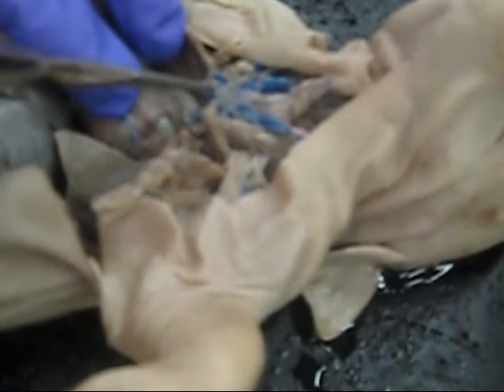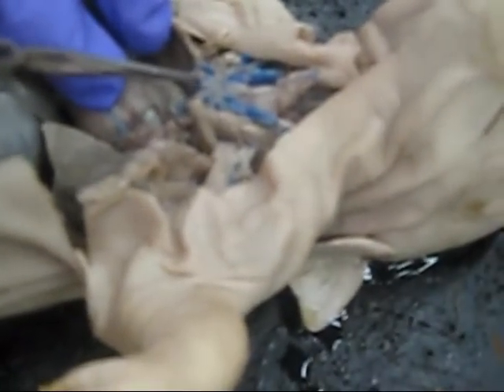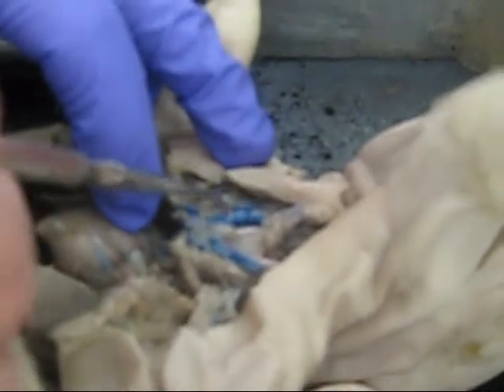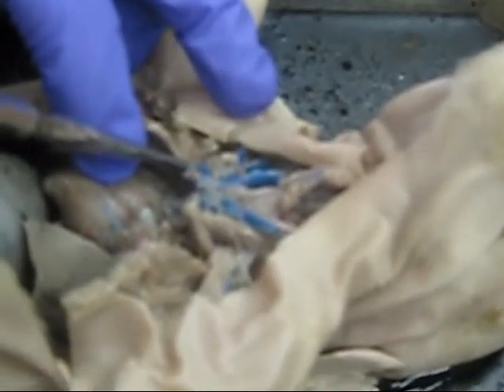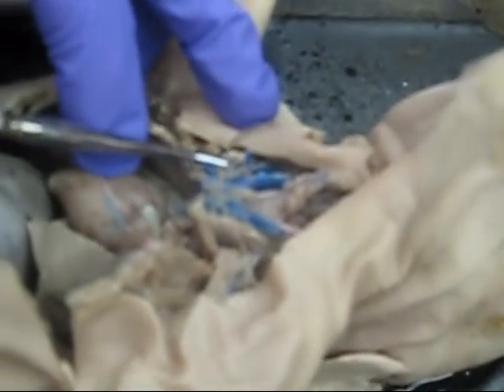This is the anterior vena cava. It moves up towards the head, and branching off from it, we have the right and left brachiocephalic veins, and then branching off of that, we have the right subclavian right here, I believe. Right here we got the external right jugular, the internal right jugular. This right here would be the right suprascapular.